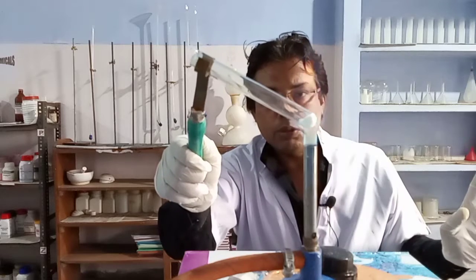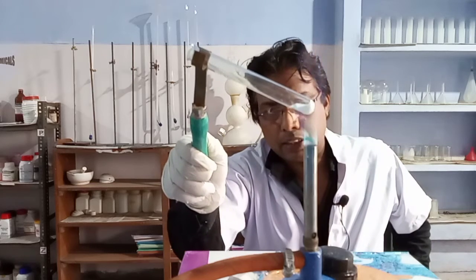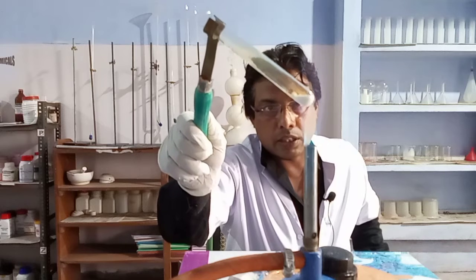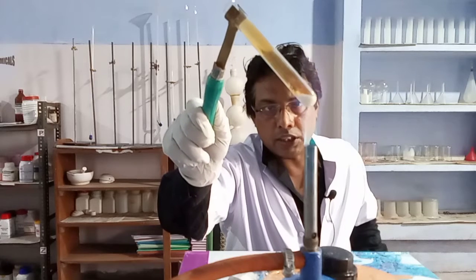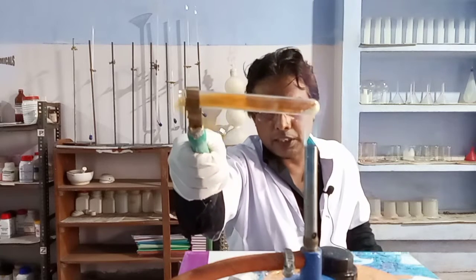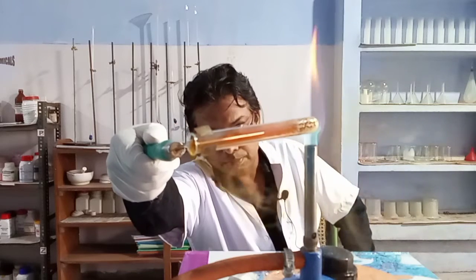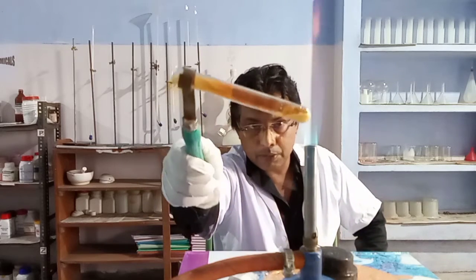As you can see, there is a cracking sound. The cracking sound is coming. Gas and a few fumes are being released from the mouth of the test tube. You can see some brown colored fumes being released — that brown colored gas is nitrogen dioxide. Observe carefully that nitrogen dioxide is being released.